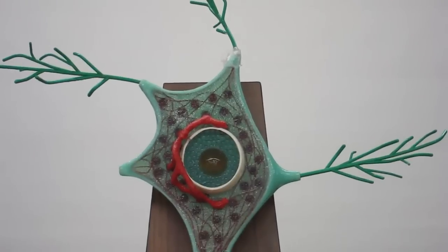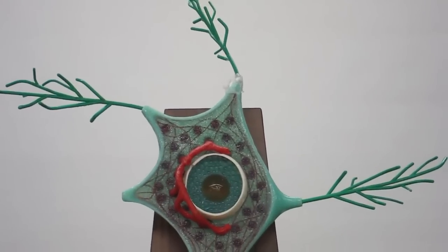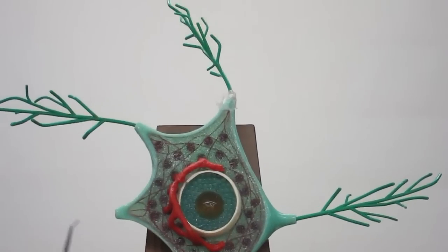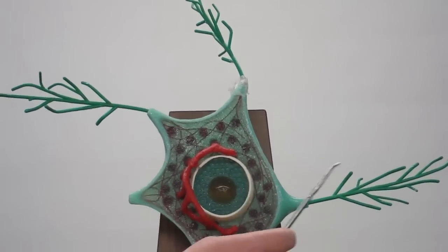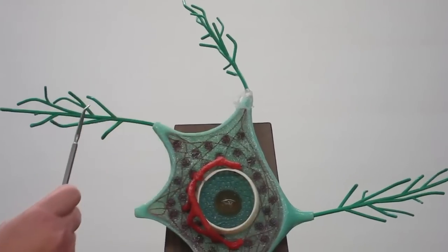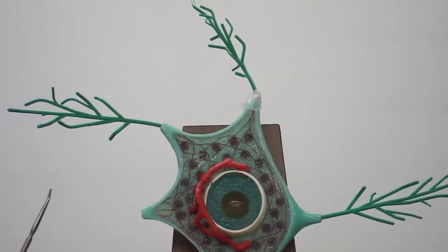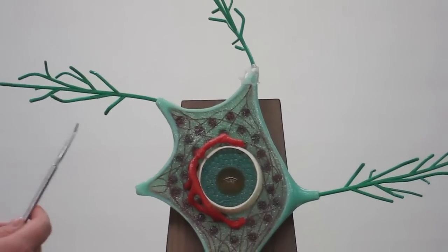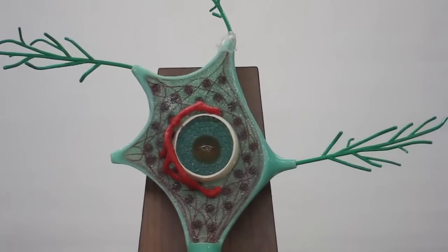When you have a multipolar neuron, that means you have more than one dendritic process. These are the dendrites out here — these structures that look like little green branches — and they're branched because we're getting lots of surface area.